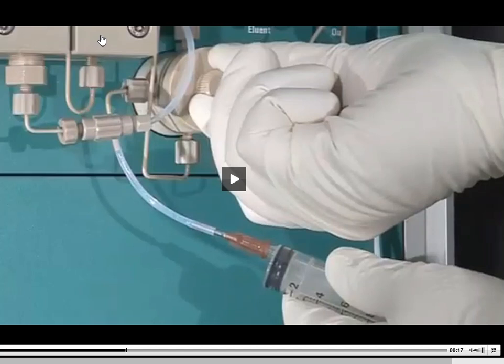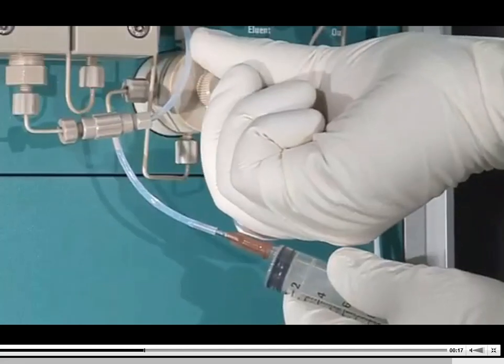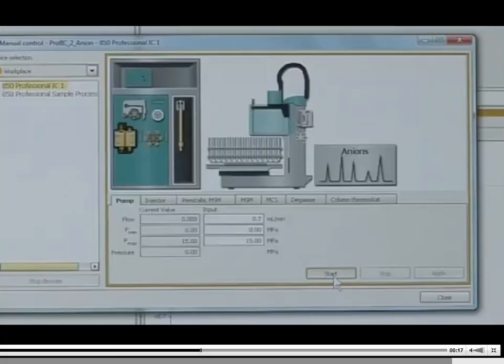And then I'm going to turn the pump on, and that air bubble is basically going to pump itself out of the system and into the syringe, and then I'm going to see a flow of mobile phase. When I see a flow of mobile phase in that syringe, it gives me a very good idea that things are happening the right way and that I'm getting mobile phase, now if I close that purge outlet. All right.